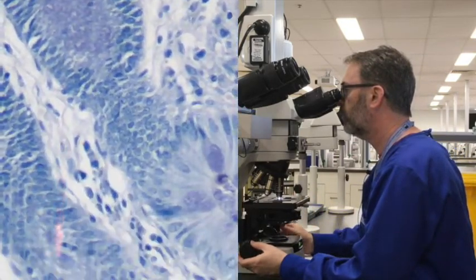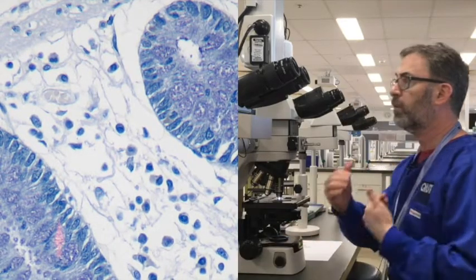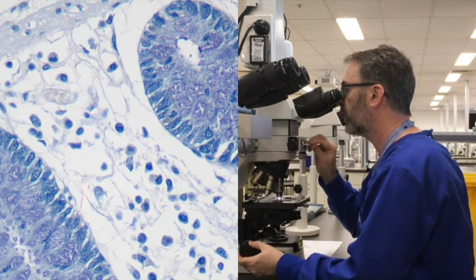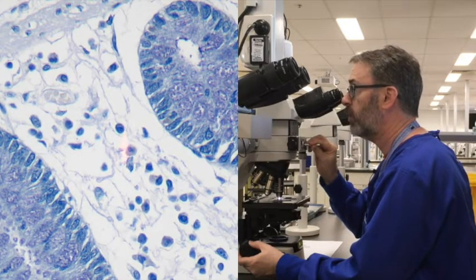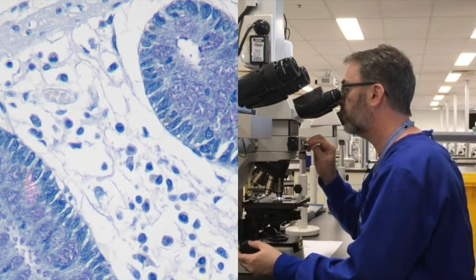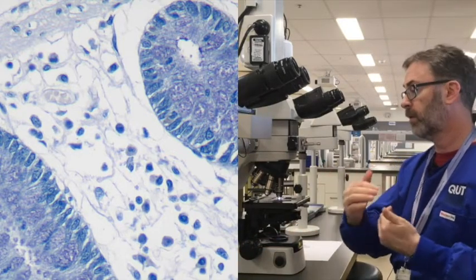Going back perhaps to the nuclei, the other thing worth noting is that within a well-stained nucleus, you often want there to be a little bit of light and shade so you can make out the various nuclear features. And it's not too bad, but if you look at, for example, what looks like a lymphocyte here within the connective tissue, it's very difficult to make out the nucleus from the rest of the cytoplasm. And indeed, some of these nuclei within the epithelium itself are generally quite dark without being able to see nice contrast between the light and the darker areas.